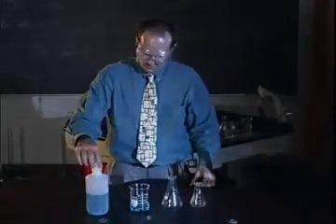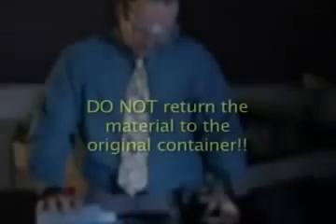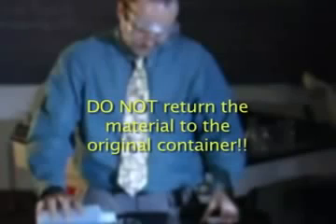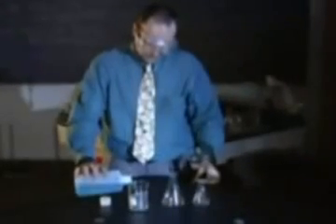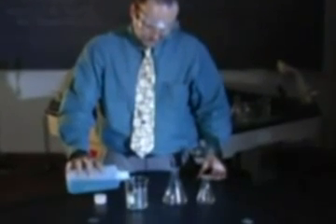If you pour out too much of the solution or chemical, do not return the material to the original container. Place the excess material in a waste container. You must always remember that many groups of students will use the same stock solutions. Contamination in one lab by one student can result in erroneous results for as many as 100 students.